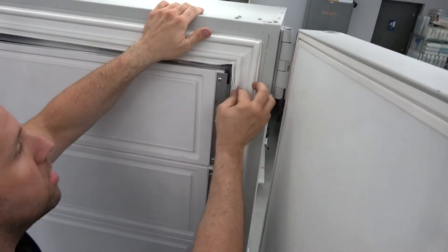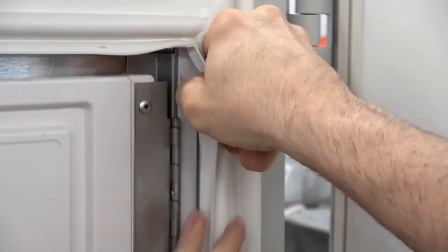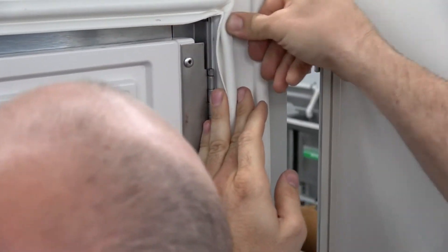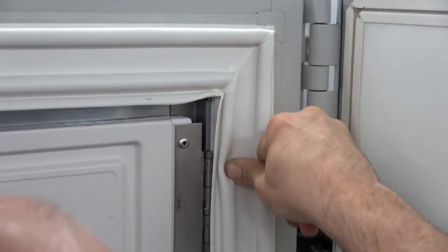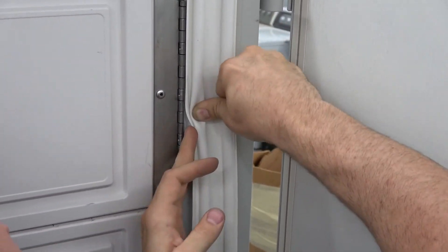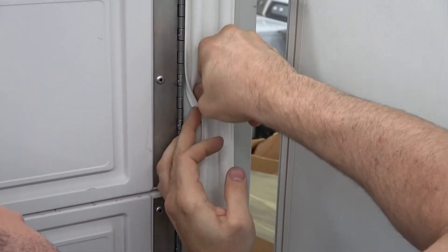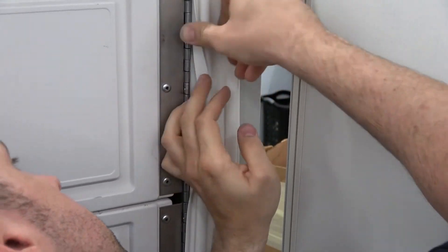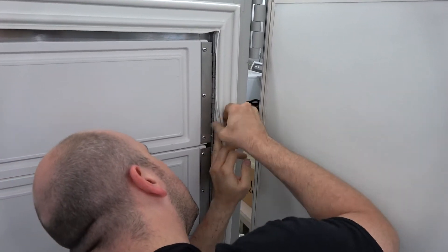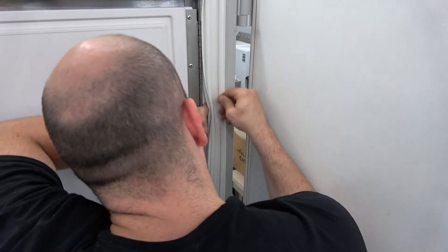It really is shockingly easy. When I first went to change one of these, it looks kind of intimidating because it's stuck in there so hard and secure — you think certainly there's some adhesive holding it in. But there's not. It just fits right into a channel. So easy. Warning though: your thumb and fingers might get tired. Other than that, it's not too bad.